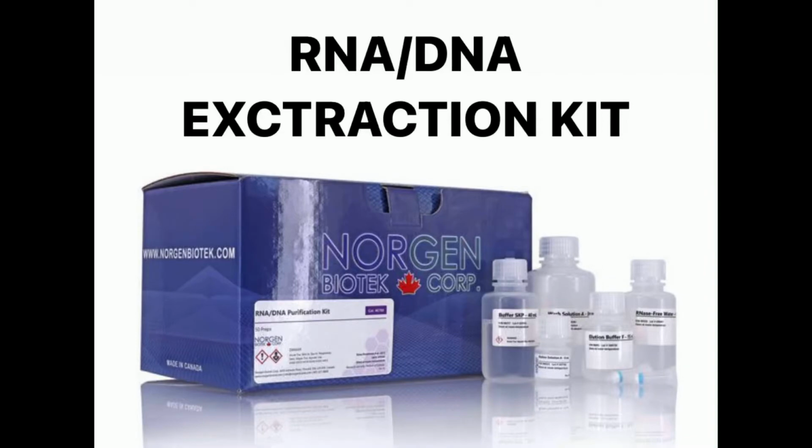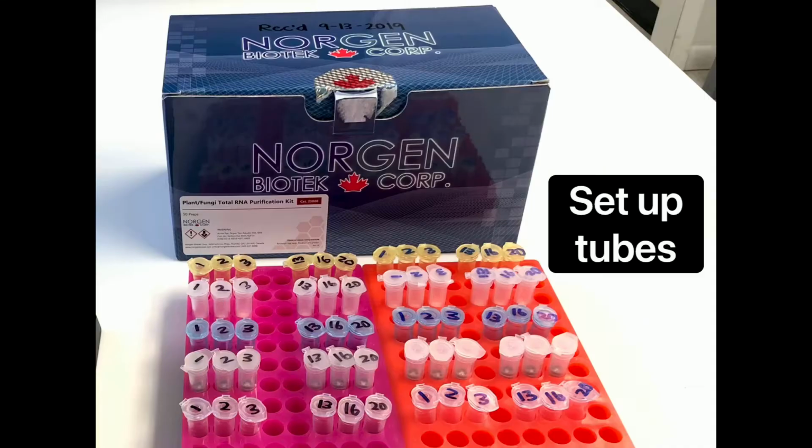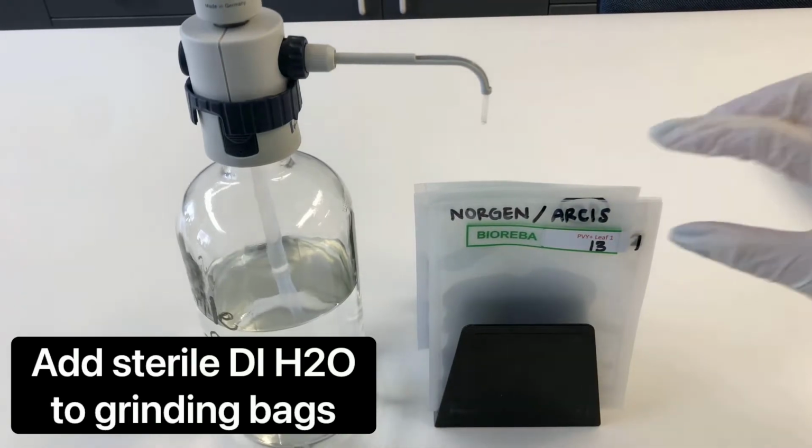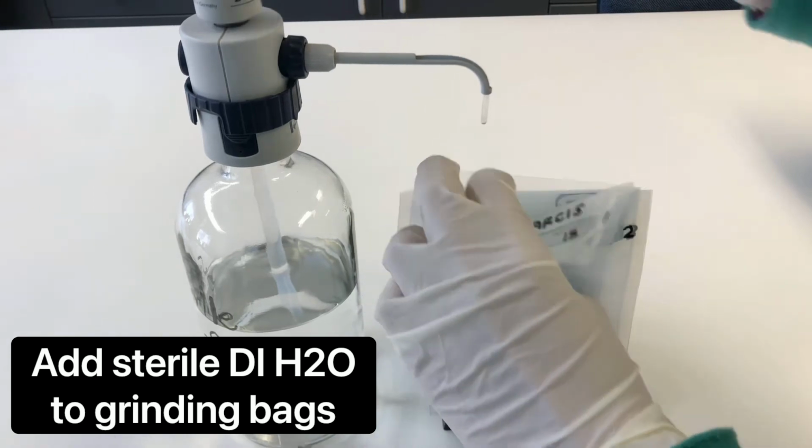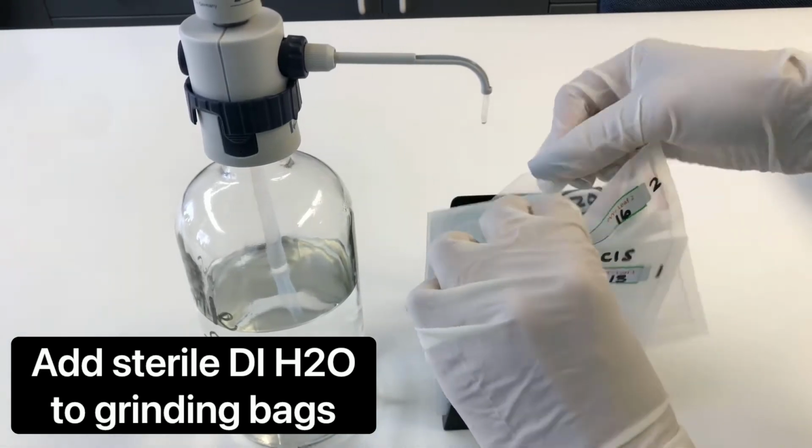I will be using a commercial RNA/DNA extraction kit. We are going to simply follow the protocol that comes with the kit. First, you're going to want to set up your tubes like so. We're going to start out by adding a small amount of sterile DI water to some grinding bags.